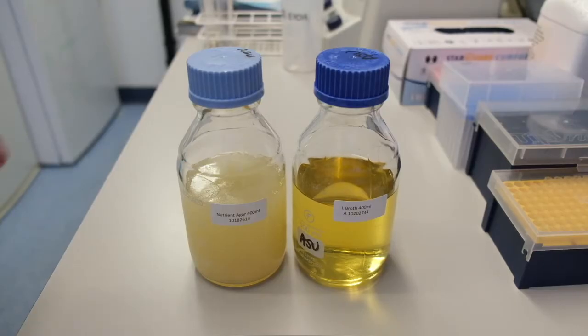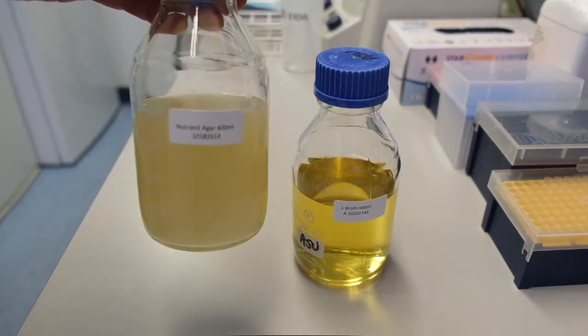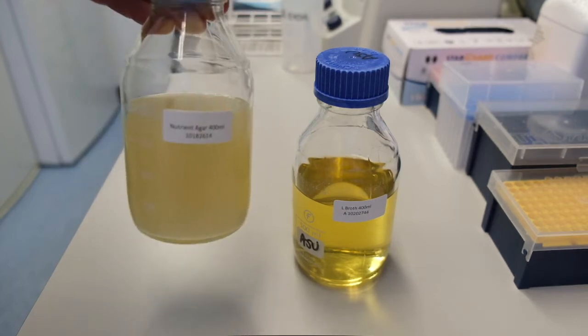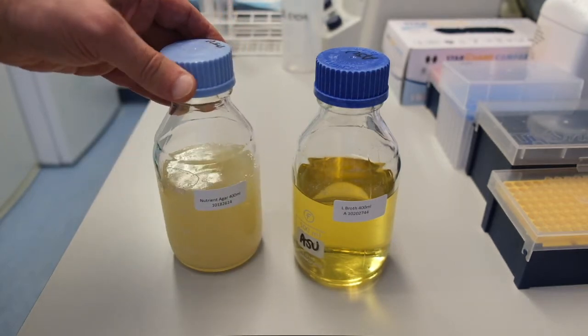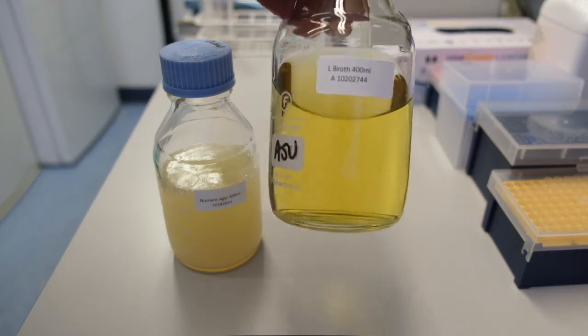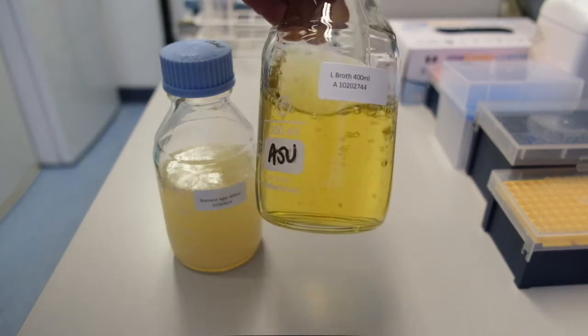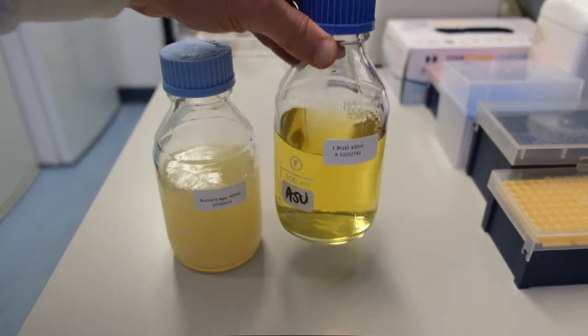We'll be using a bottle of media with agar in it to make it solid, like this. Here's a bottle of the same media with no agar in it. As you can see, it's liquid.